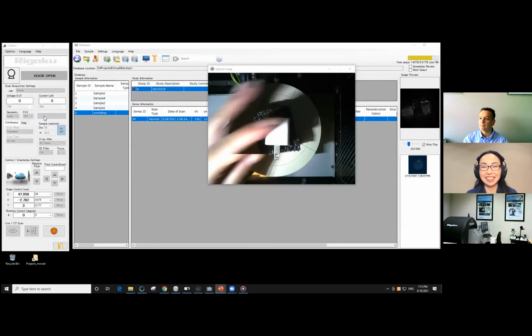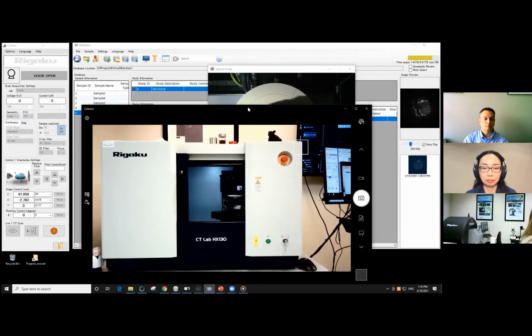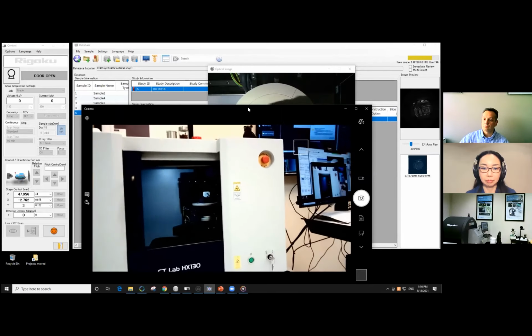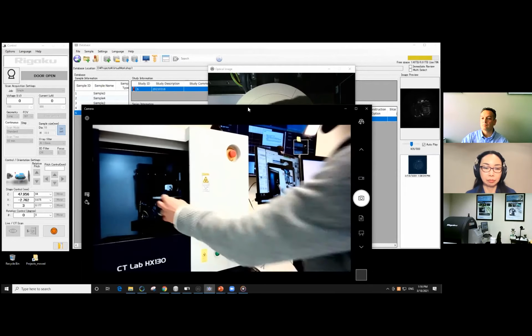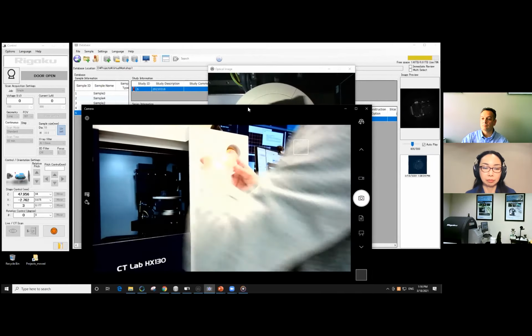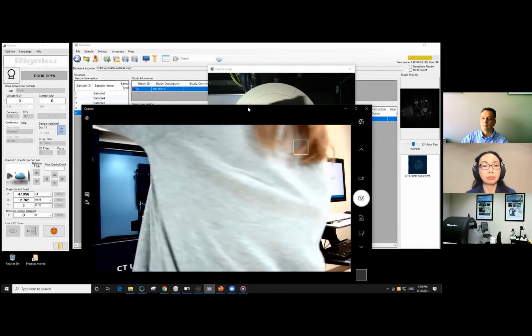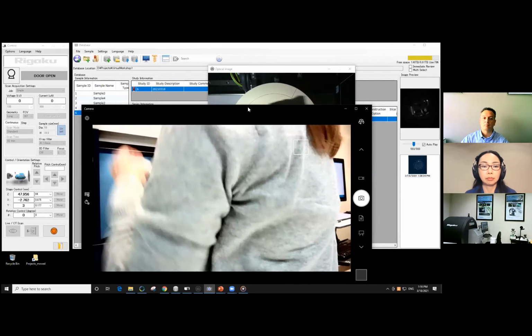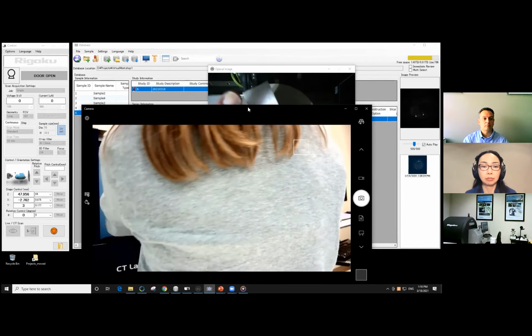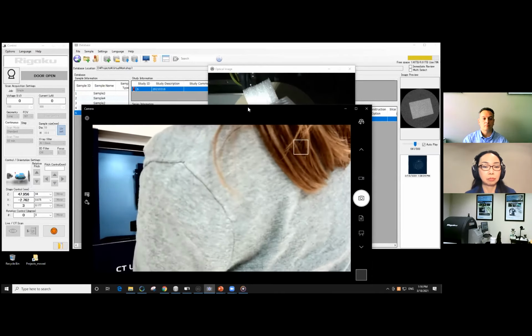That's right, selected. But what I want to do is switch back to the camera for just a second and show you what's going on there. All right, when I change the field of view to 100, now the sample stage is moved a bit. I'm going to take this one out and put this one in, and I can simply use a piece of foam that's got a wedge shape. I've got an even smaller one to tilt this particular sample. So, all right, it's in there. Let's hope it stays put.